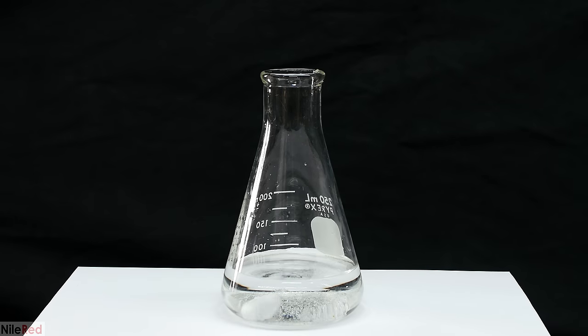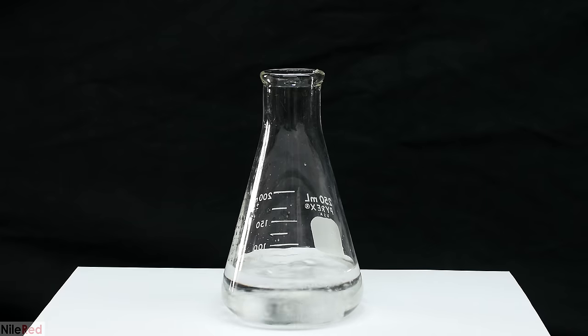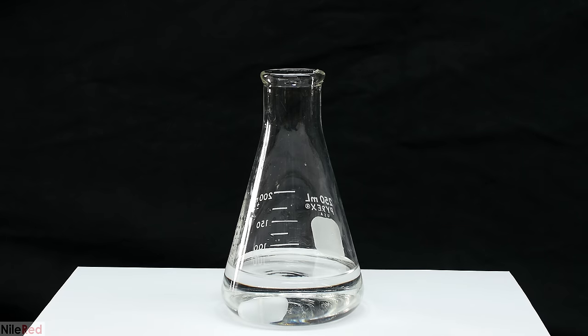In chemistry, a buffer solution is a solution that resists pH change. The buffer here has a pH around 5 and if a small amount or even a moderate amount of acid or base is added, the pH shouldn't change very much. This is really useful for pH sensitive reactions and it allows us to keep a nearly constant pH throughout the entire process.